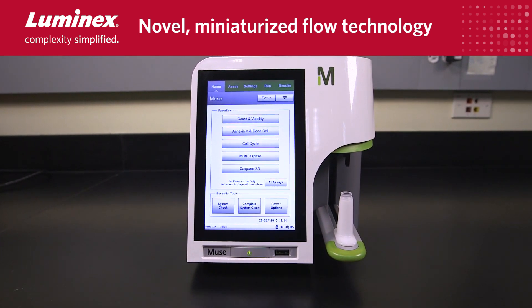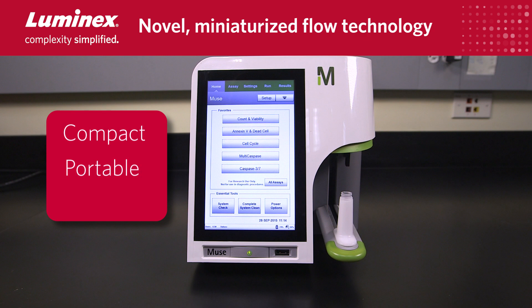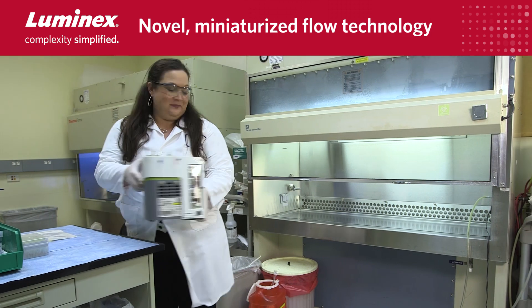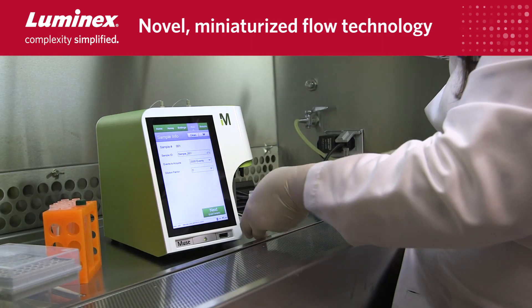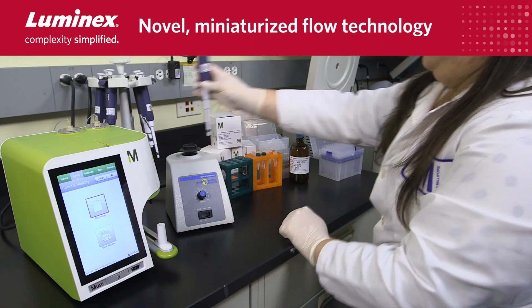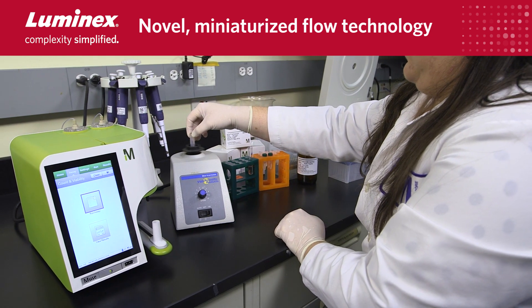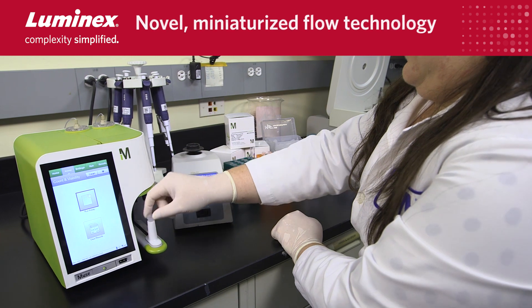This means we have been able to introduce a truly compact, portable cell analyzer powered by flow cytometry that is designed to fit easily within a tissue culture hood or on any bench. Now, sophisticated cell analysis can be performed in virtually any space, by anyone in the lab.